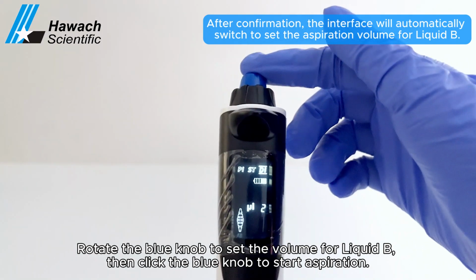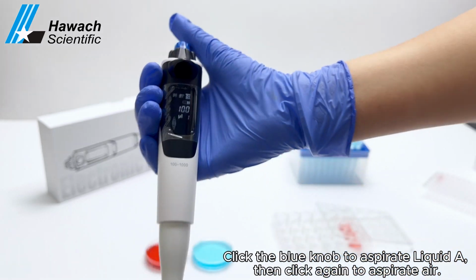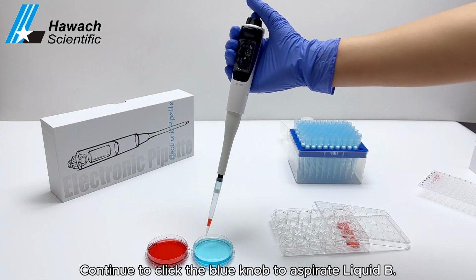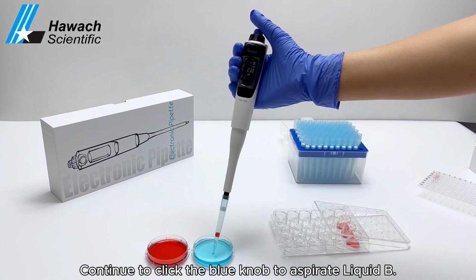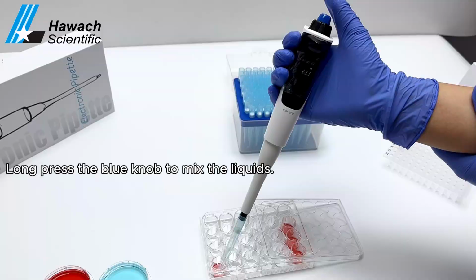Then click the blue knob to start aspiration. Click the blue knob to aspirate liquid A, then click again to aspirate air. Continue to click the blue knob to aspirate liquid B. Long press the blue knob to mix the liquids.